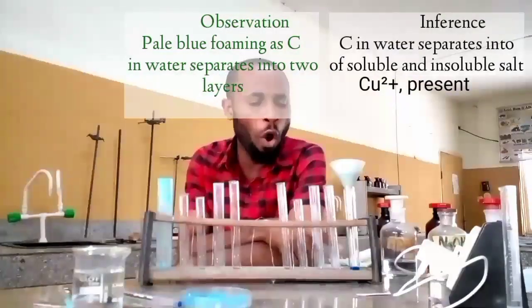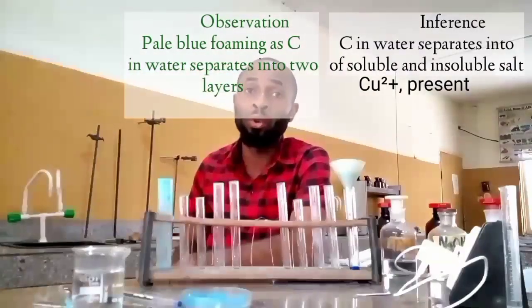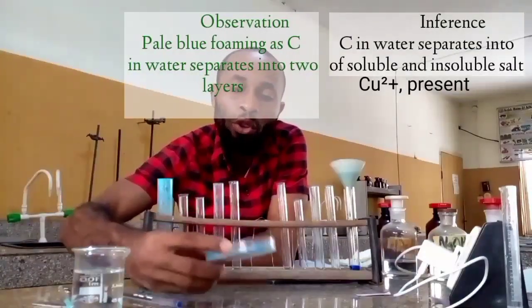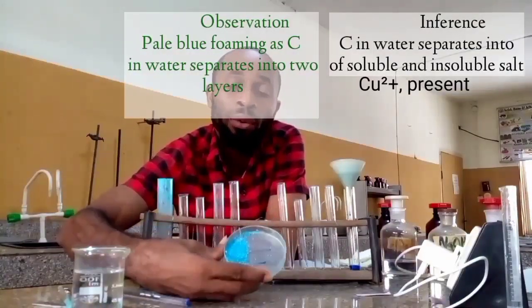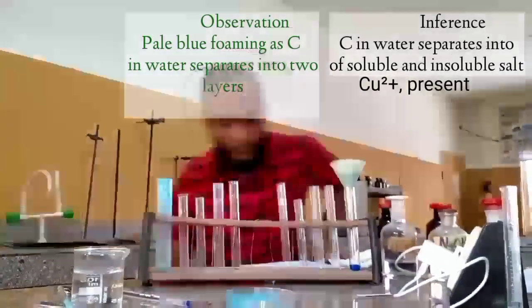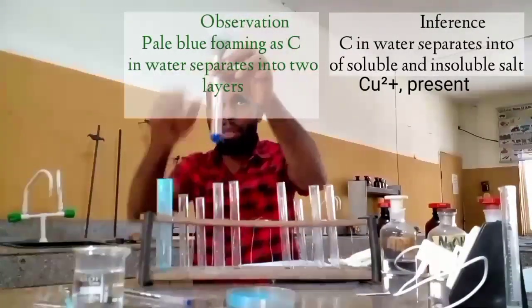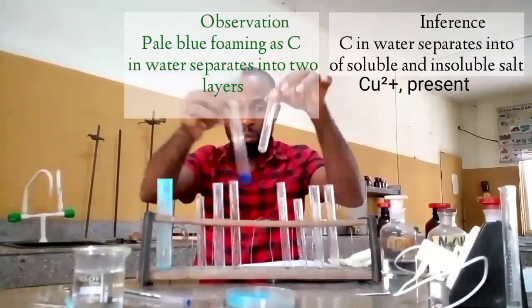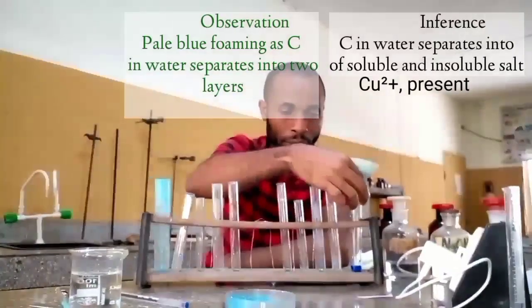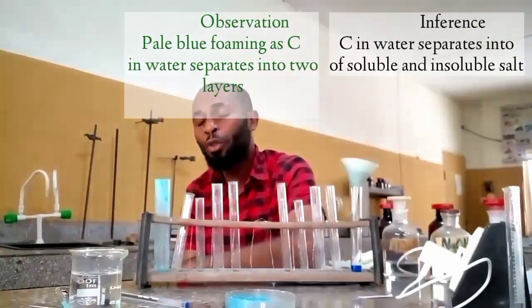There's no need for you to wait for all the filtrate, that is, this that is coming down from this, to all come down before you do anything. Also, at the same time, you can notice that the color of this is also changing from what it was. I believe by the end of this practical, the color of this will really change. Okay, if you notice, we are having some good work coming down here. You can see the color. See, the color is coming out gradually, and this is showing a deep blue solution.